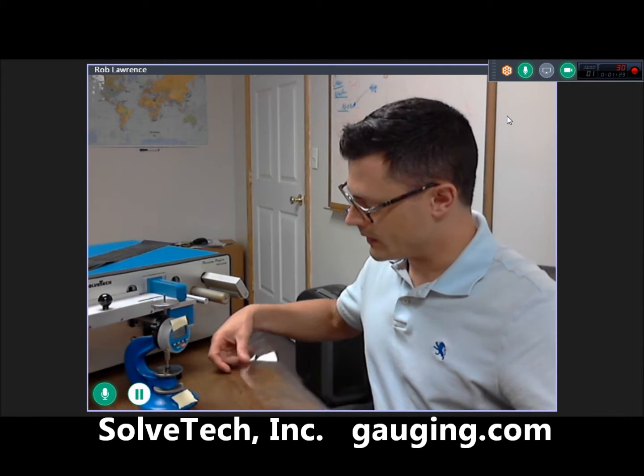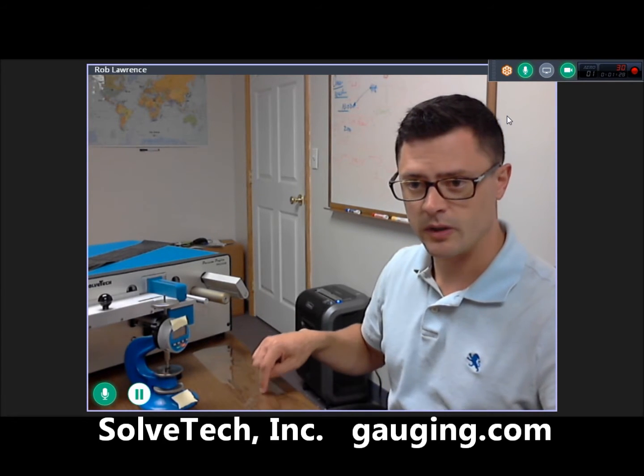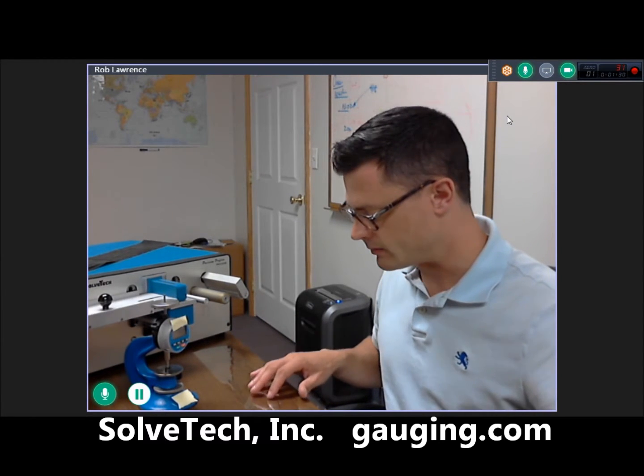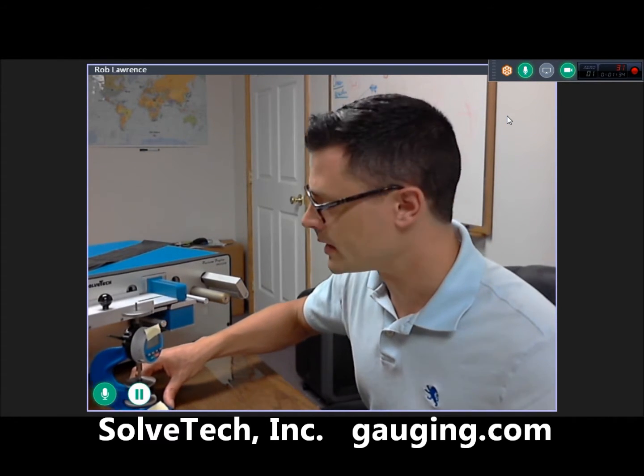So it works pretty well, but again, there's some limitations, and if I'm going to profile, maybe I need to measure multiple spots along this film, and I'm obviously not going to measure every spot because it's just a little bit too much labor and time for me.